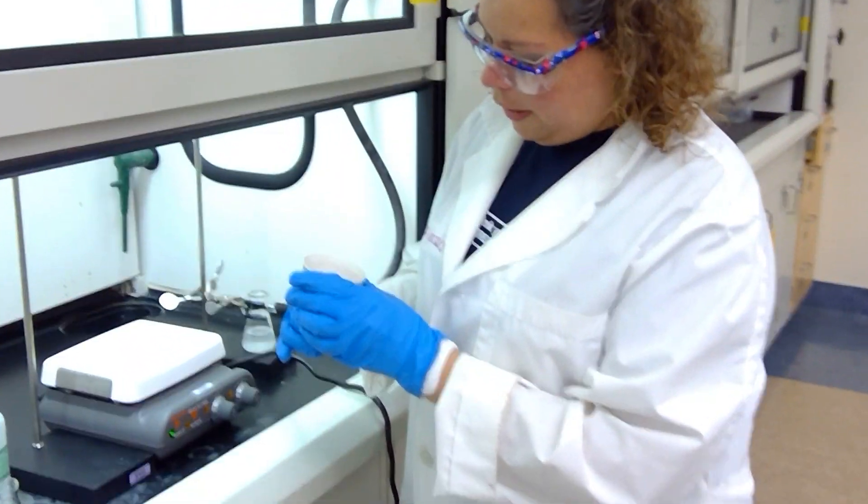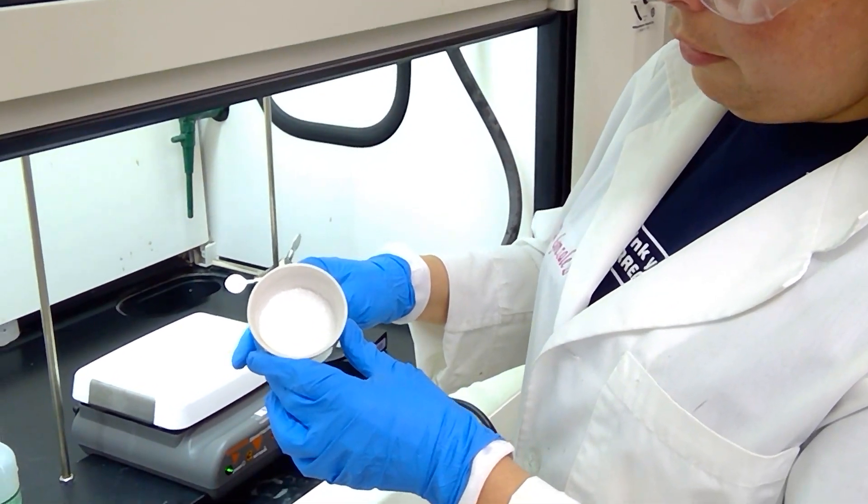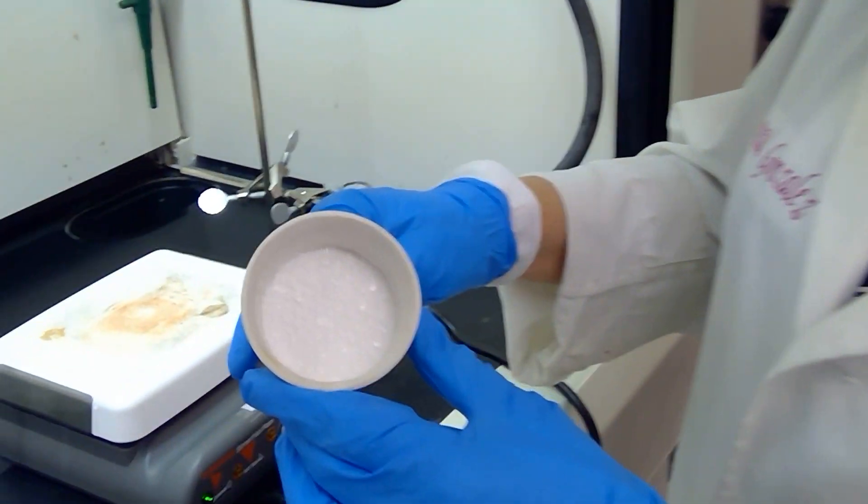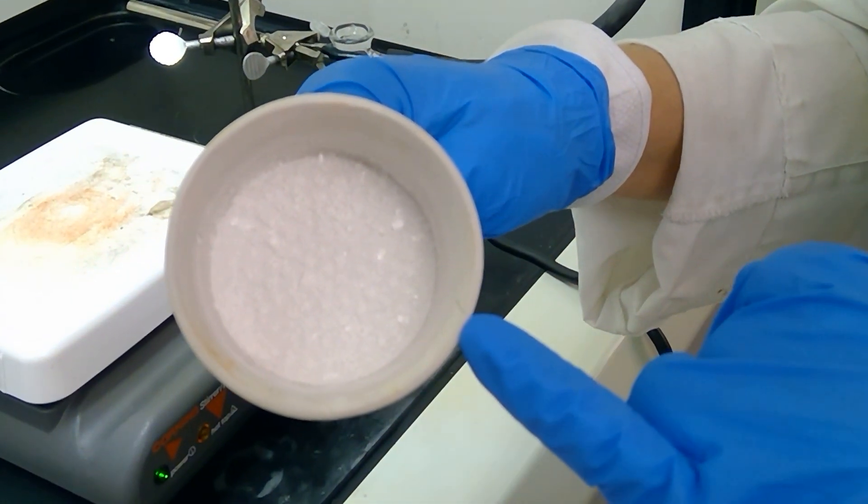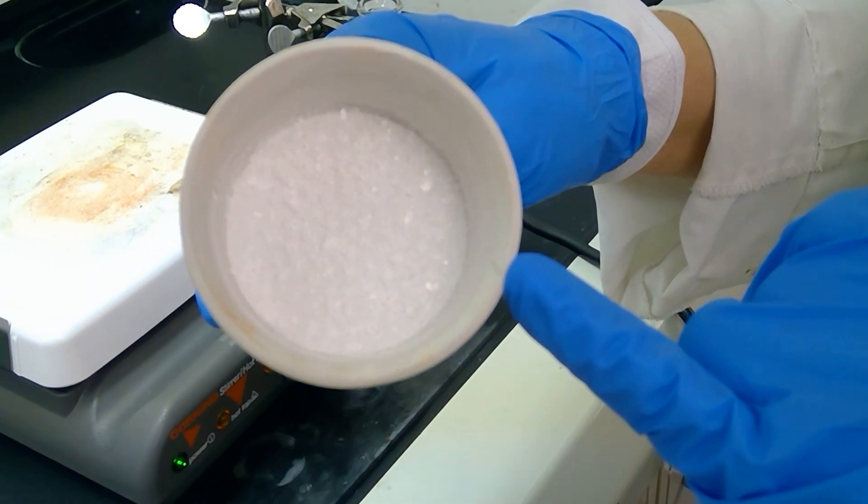After drying the product, we have this final solid as our benzhydrol product. I'm going to go ahead and take this to the scale, weigh it all out, and see how much mass we have isolated.